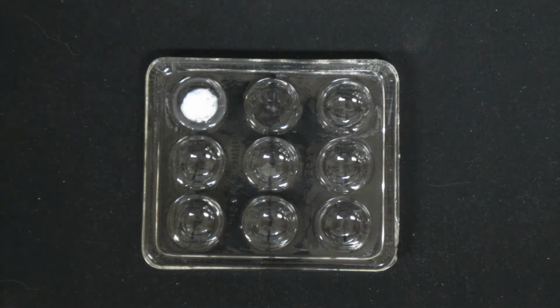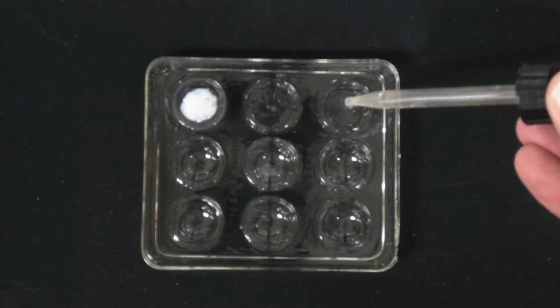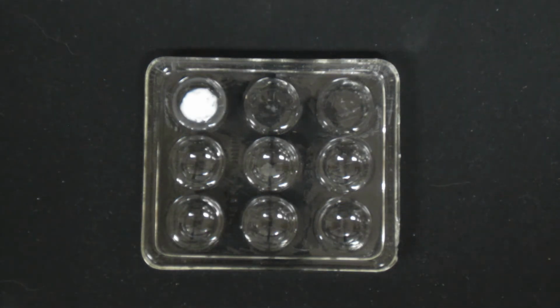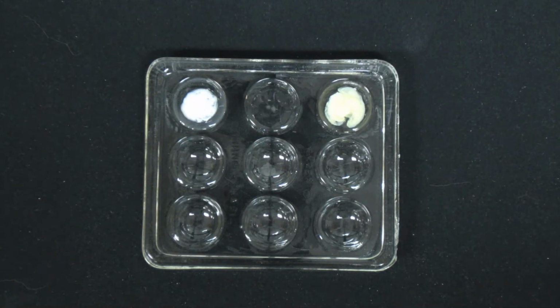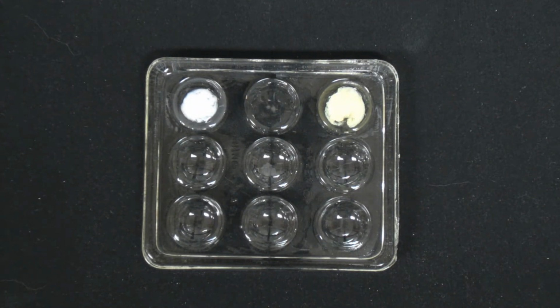The third reaction, again, we got silver nitrate, and we are going to, just like before, add a few drops. Doesn't really matter how many. And then the second reactant is the sodium phosphate. Here it is. I would show you the label on the bottle, but the glare on here is a little bit strong. It's a little bit hard to see. You can see though, the solid forming. And I'm not sure how well it's being picked up on the video, but it is a yellow solid for that reaction there.